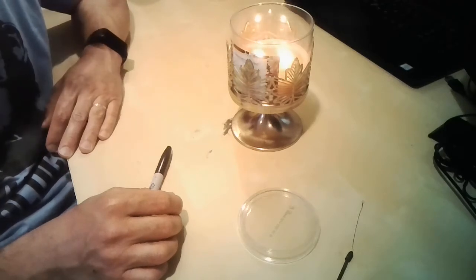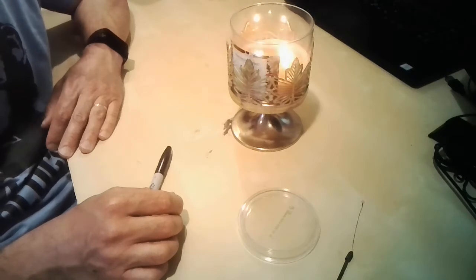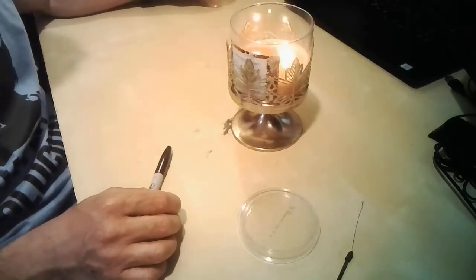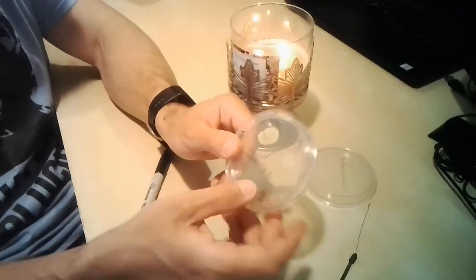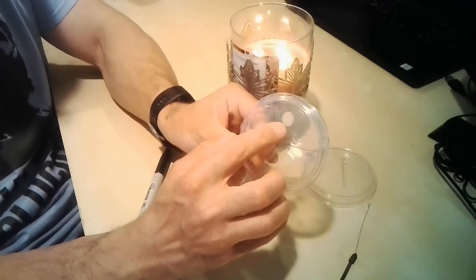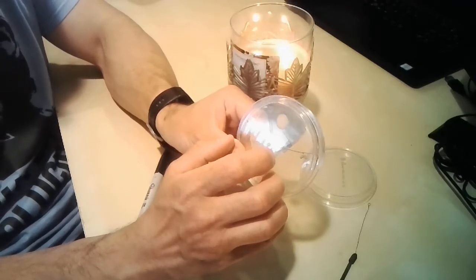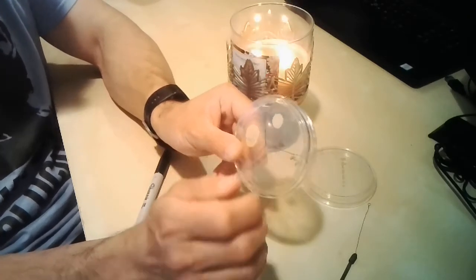So what we usually do is inoculate the surface of a table with a microorganism and then let it dry. This time, for obvious reasons, we won't be able to do that. So my intention is to use this particular colony, what is most likely Bacillus, as the initial source, and then you will see what I will be doing.